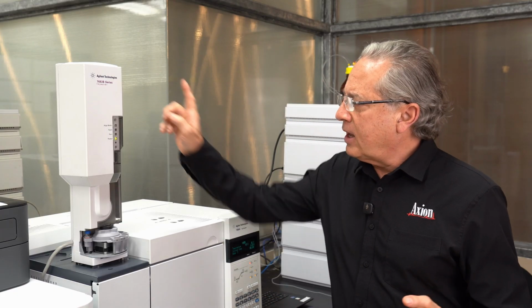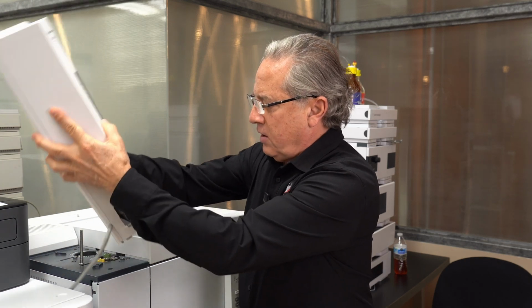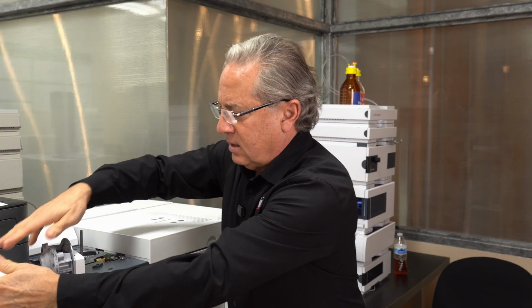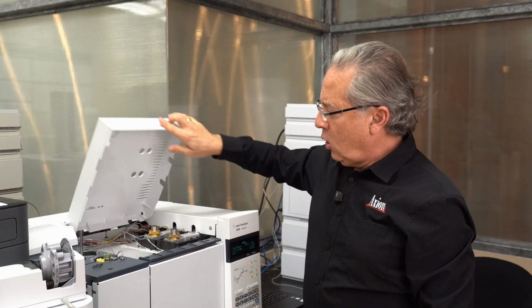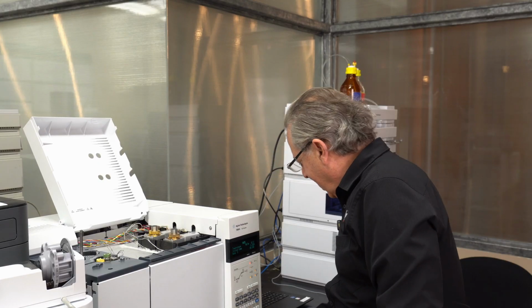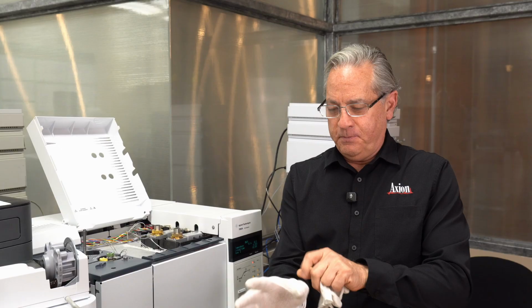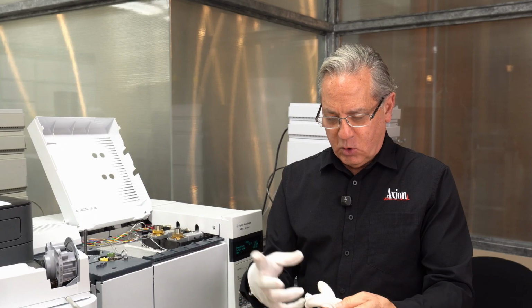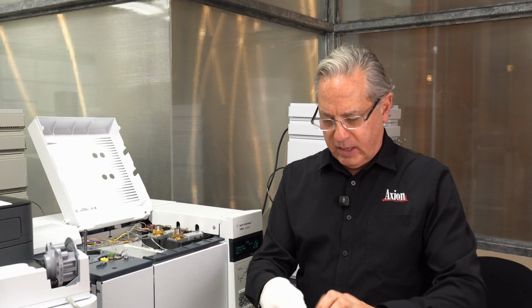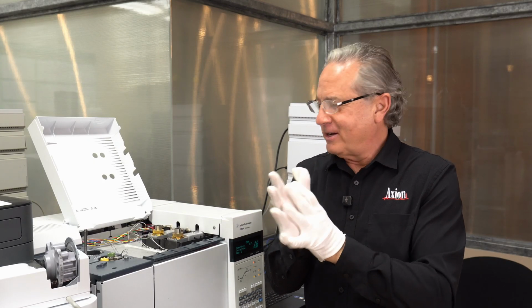So to take out the liner, I'm just going to remove my sample so it doesn't spill. I'm going to pull this off. I'm just going to set it on the side. That allows me to open up this top, and puts me in a little better position when I'm going to open the liner. Now, since this whole thing is hot, since my injection port is currently sitting at 250 degrees Celsius, I don't know, what is that, 450 Fahrenheit? I'm going to put on some cotton gloves so I don't burn my little fingers, or a better way to put it, I'm still going to burn my fingers. It just won't hurt as much.